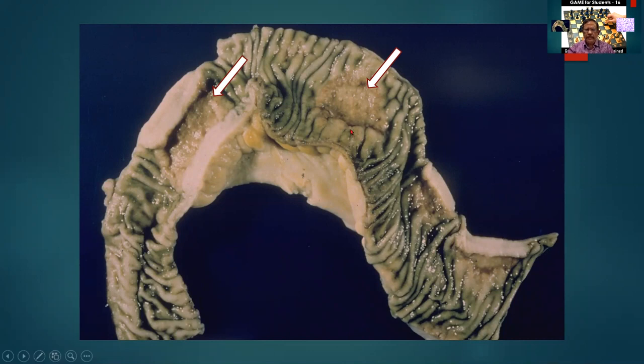Again, a part specimen of the intestine measuring so many centimeters long. The external surface is pinkish brown and it may show a few nodules. Kindly look for it. If there are no nodules, just leave it as unremarkable. There are two ulcerative lesions marked by the white arrows, and they measure so many centimeters by so many centimeters in dimensions. They are separated by multiple mucosal folds of normal intestine.